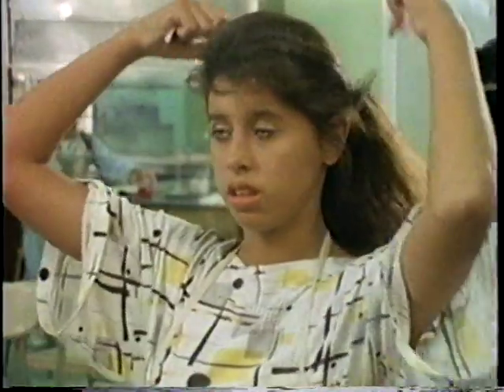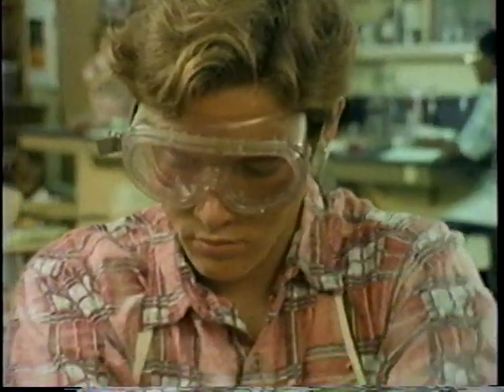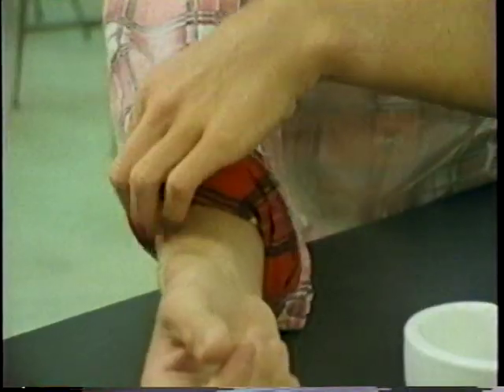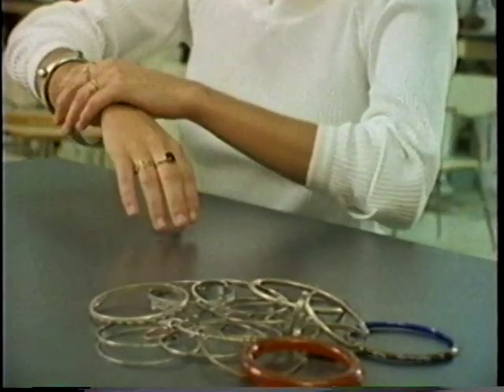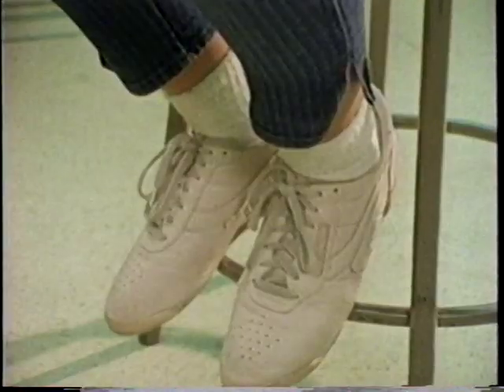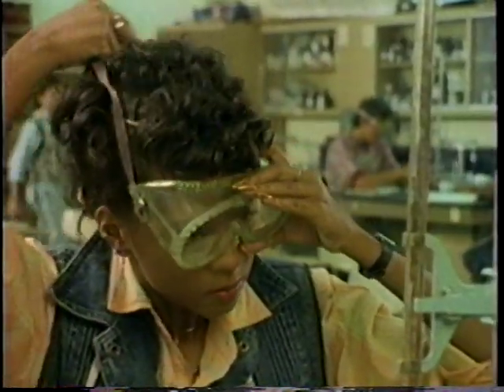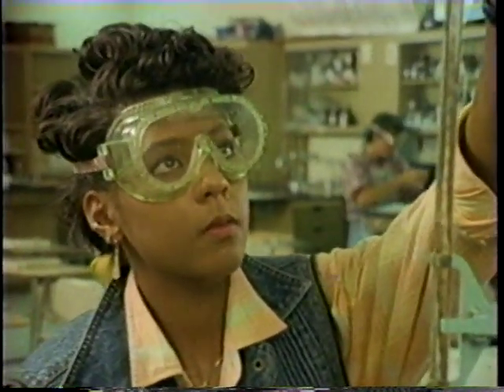Like what? Like coming to class prepared for lab work. That means tying back long hair so it doesn't get in the way. Rolling up long shirt sleeves for the same reason. Removing loose and dangling jewelry. Shoes are important. Students should never wear sandals or other open-toed shoes. Using a lab apron is always a good idea. It not only protects clothing, but the skin as well. Splash-proof goggles are an absolute must, especially during experiments involving caustic or corrosive chemicals.